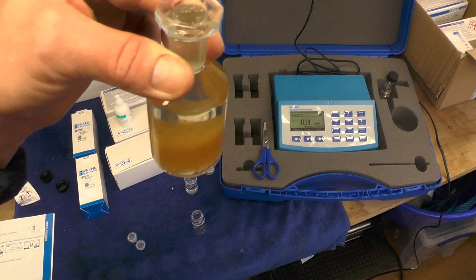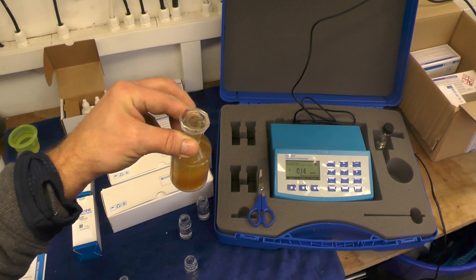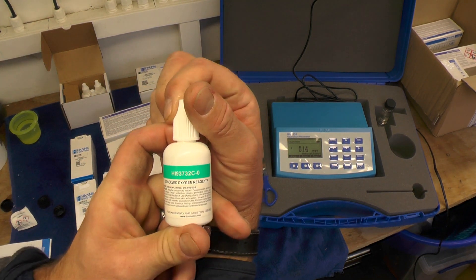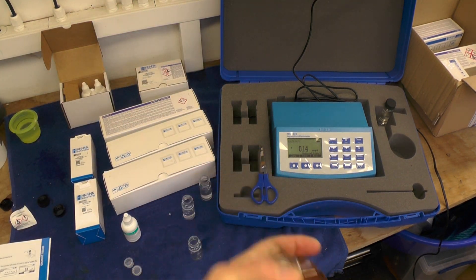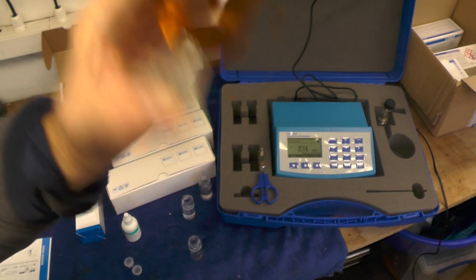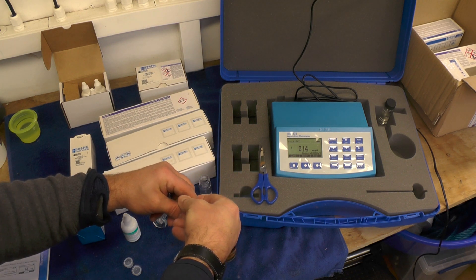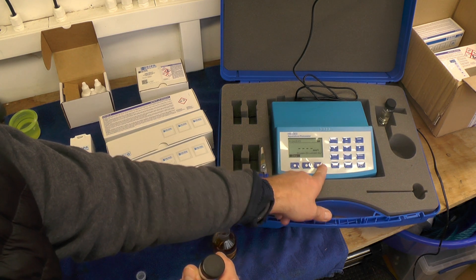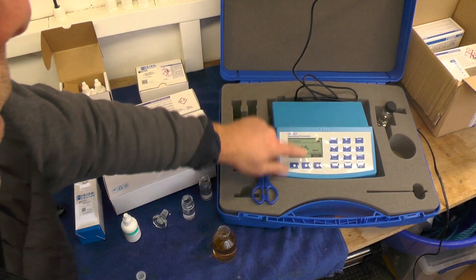What we're looking for is a flocculent to form and settle. Take off the lid, add ten drops of Reagent C, place the stopper — some water will drop out — give it a shake to get all the flocculating agent to dissolve completely. When it's dissolved completely, take a small sample into a cuvette, put on the cap and lid, then on the device select dissolved oxygen, select, open the lid, sample in, zero it, put the cuvette in and press read.